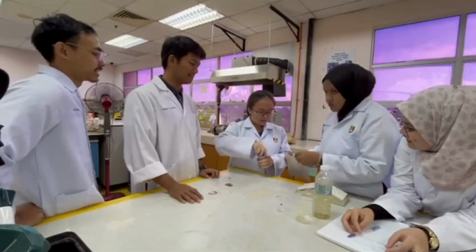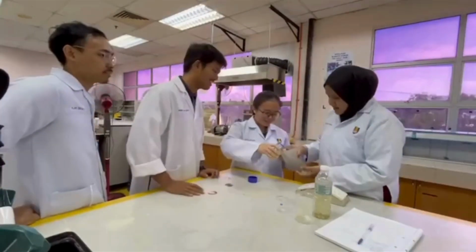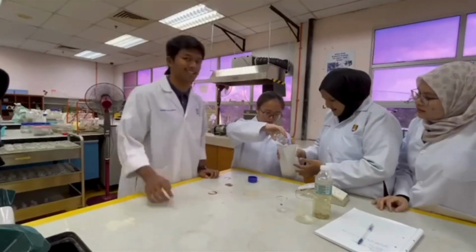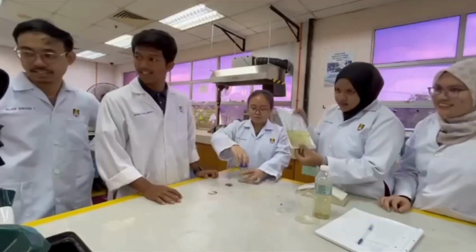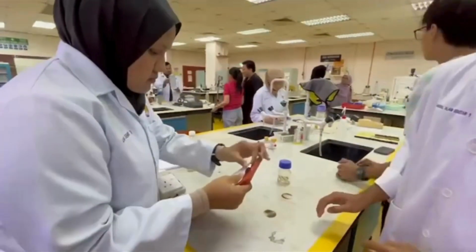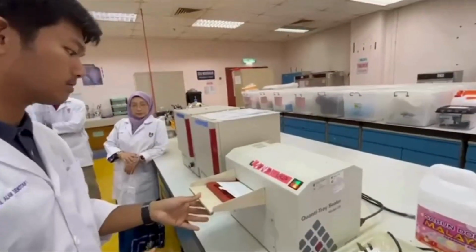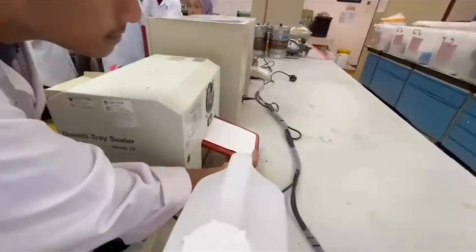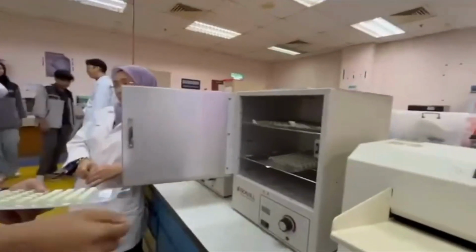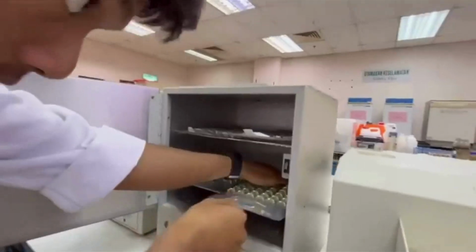After that, the reagent and sample mixture was directly poured into a Quanti-Tray. The smaller wells are tapped 2 or 3 times to release the air bubbles. The Quanti-Tray was placed onto a Quanti-Tray rubber. Insert into the Quanti-Tray sealer with the well side of the Quanti-Tray facing down. The sealed Quanti-Tray was placed in an incubator for 24 hours.